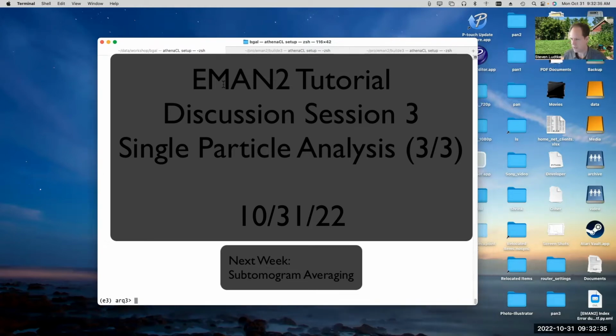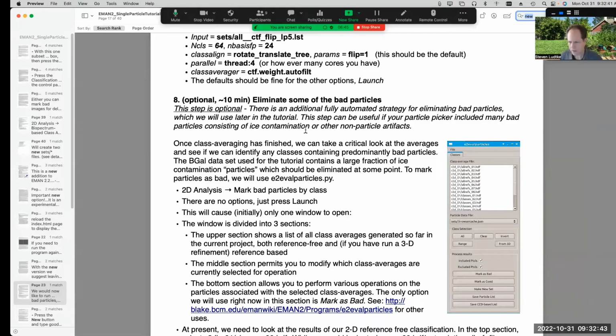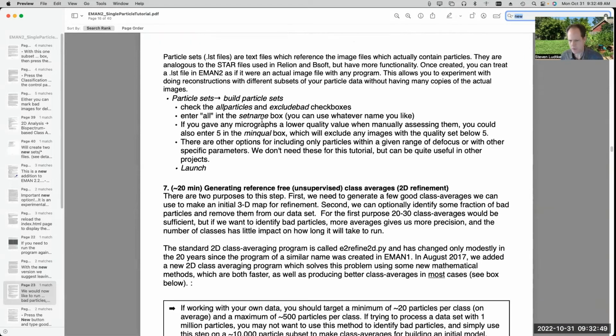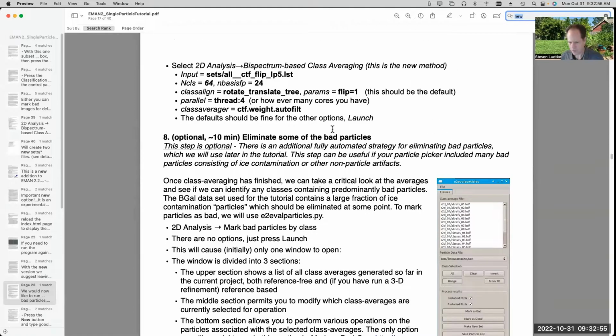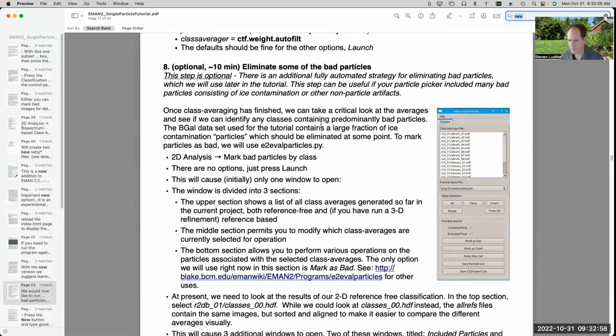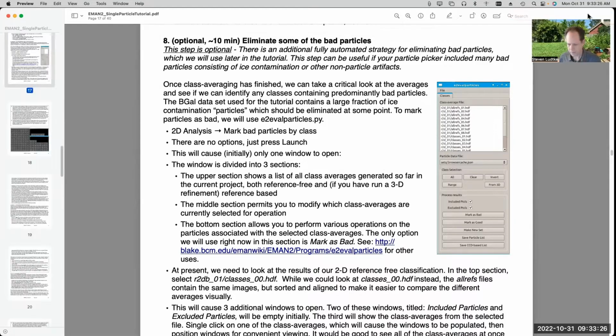So last week we got through the class averaging part of the tutorial: building sets, generating reference-free unsupervised class averages. We did that last time, but we didn't really go any further than that. So the next step would be this optional step of eliminating some of the bad particles. We have other strategies for eliminating bad particles now, which are more automated. Well, this can be pretty automated as well, but it's not a bad thing to understand what's going on with this step at least. So let's just take a look.